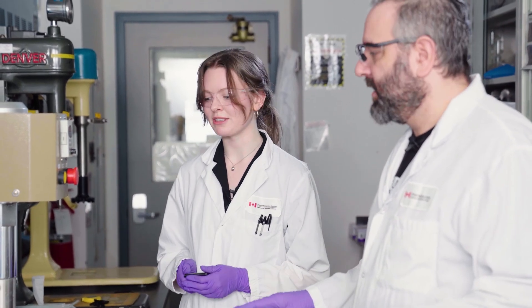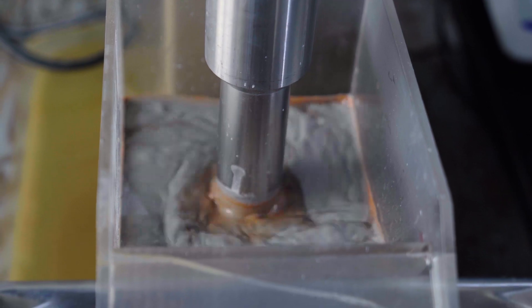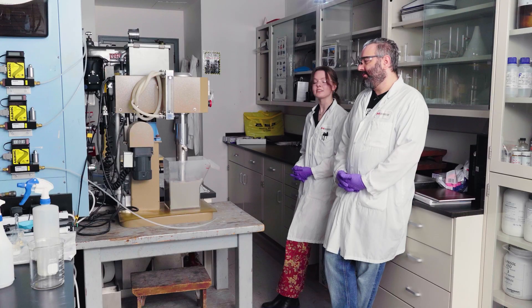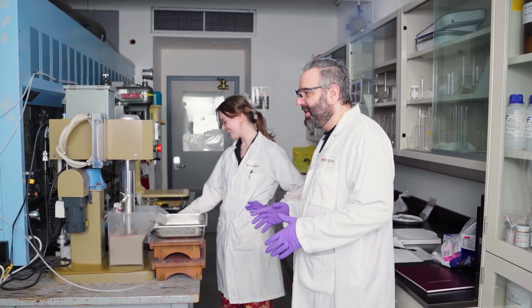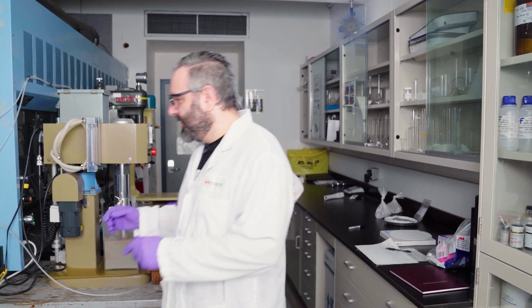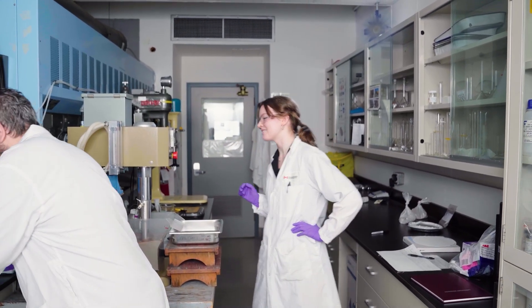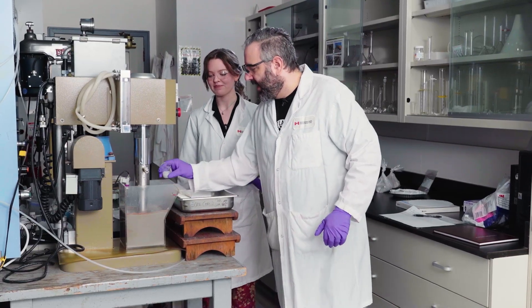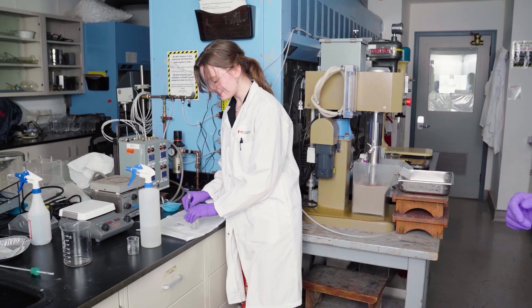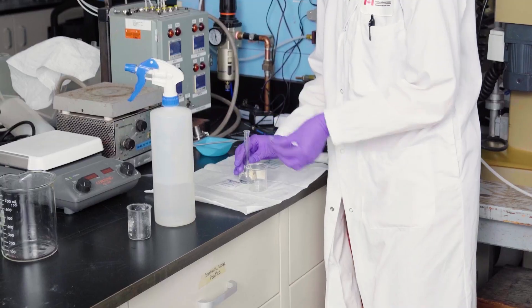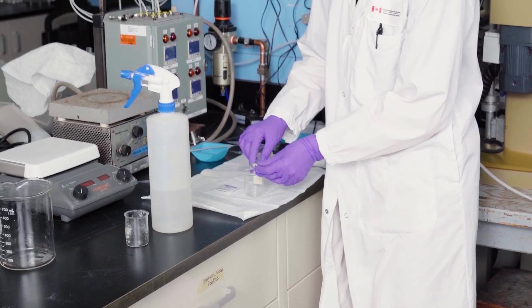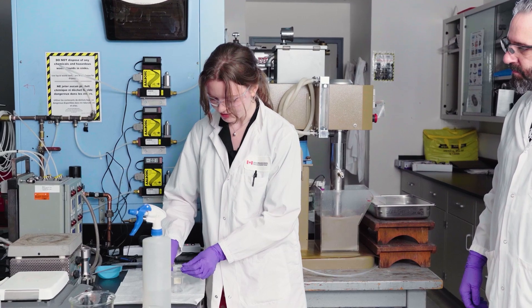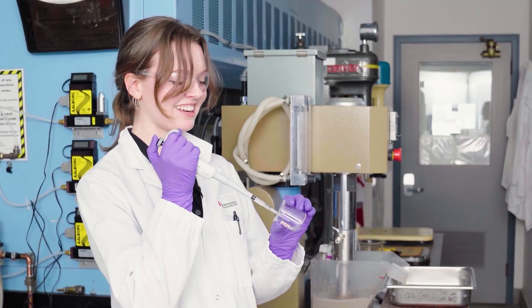Has it been 10 minutes yet? Not quite. It's been 38 seconds. So do I grab this one here? Yes. Do I pour it in? Do you trust me with that? I trust you absolutely with that. Pour it on in. This is a frother. So it's going to make it frothy. It's also really smelly. So I am going to put it in the fume hood after we're done. Add this in. Oh, wow.